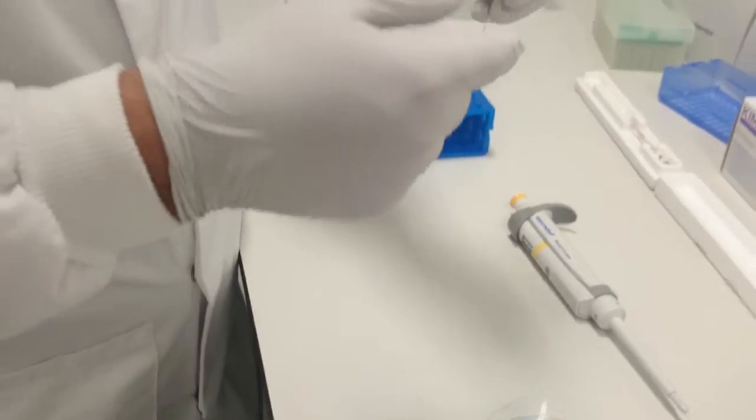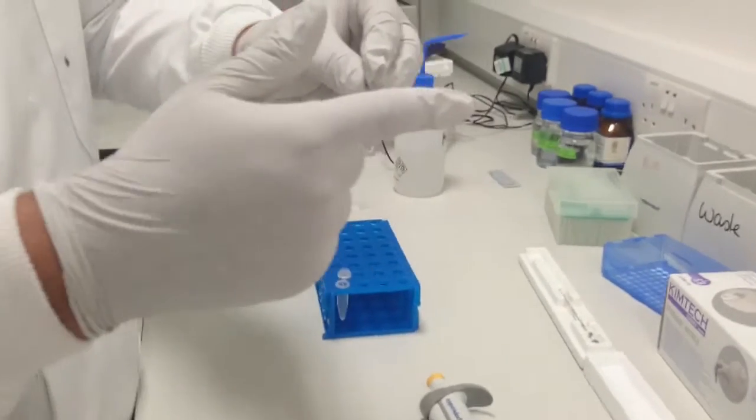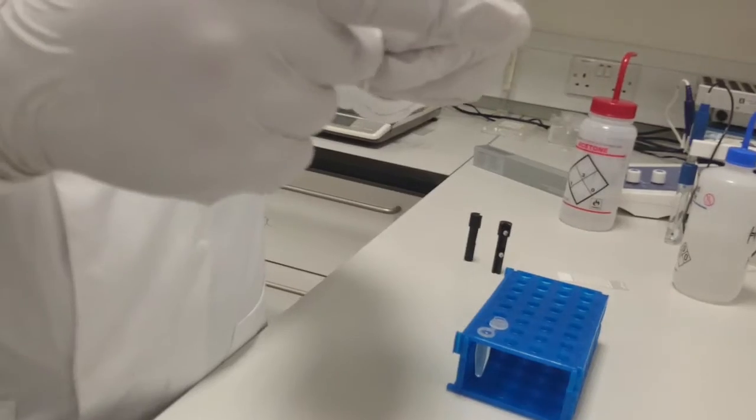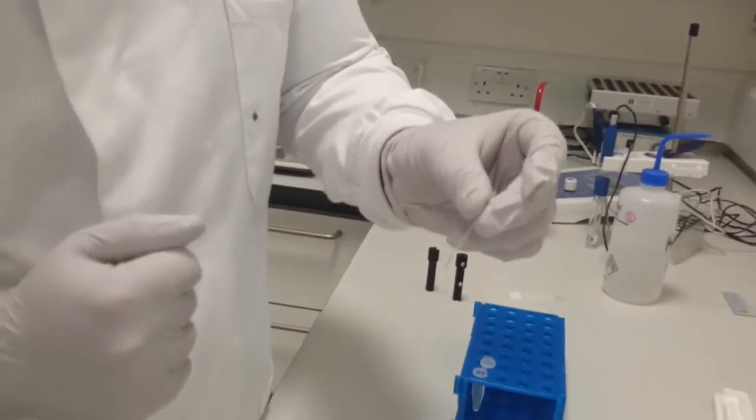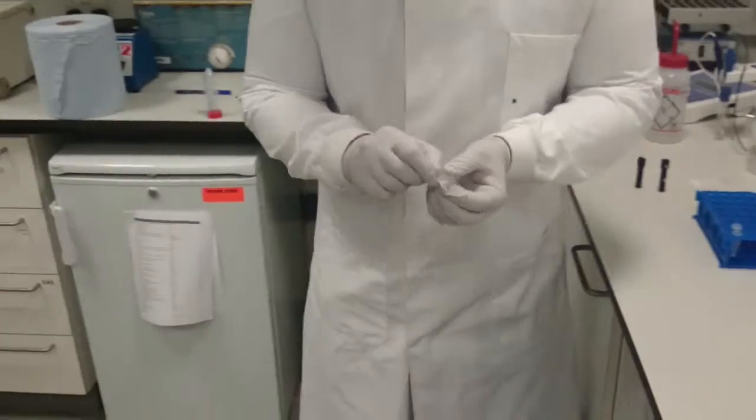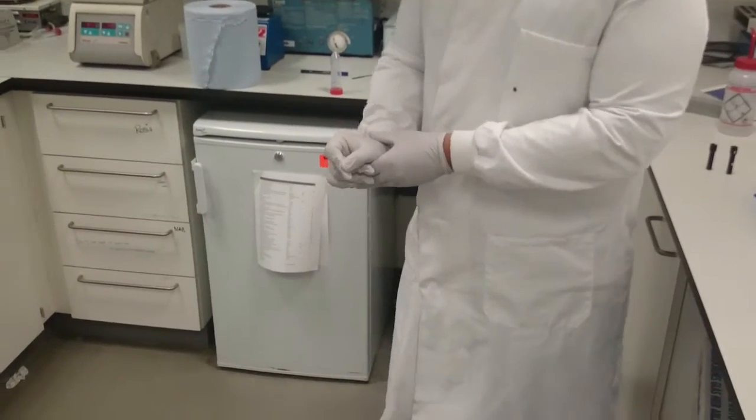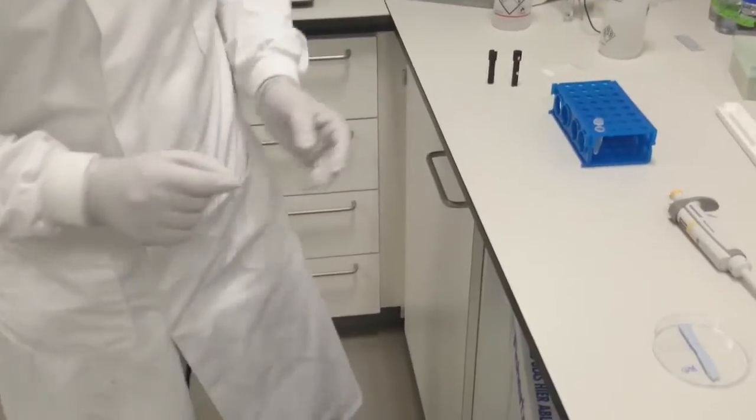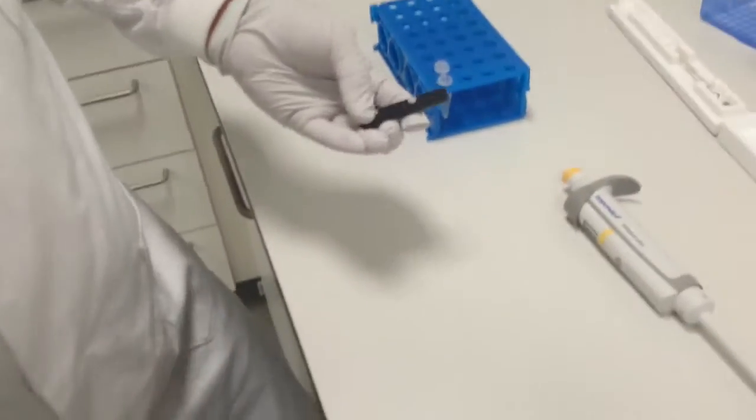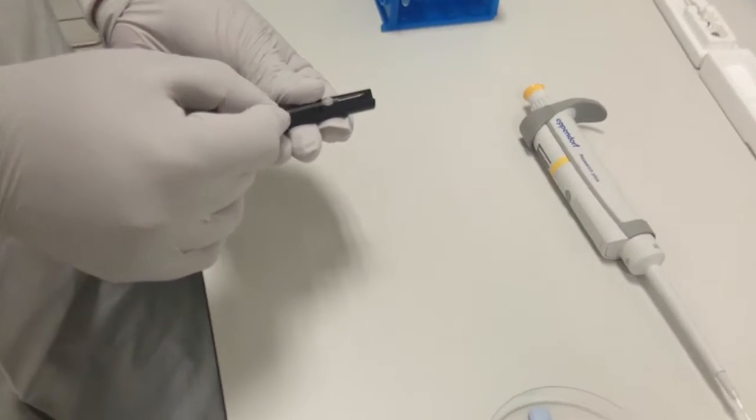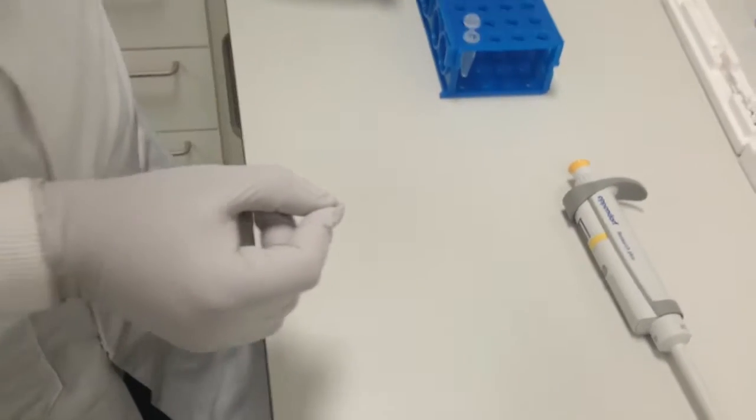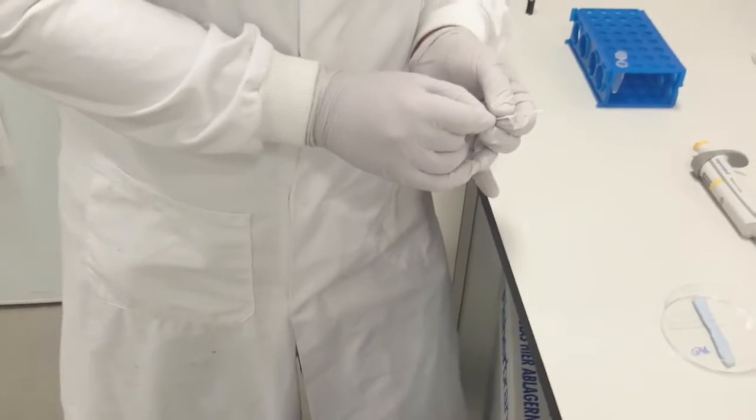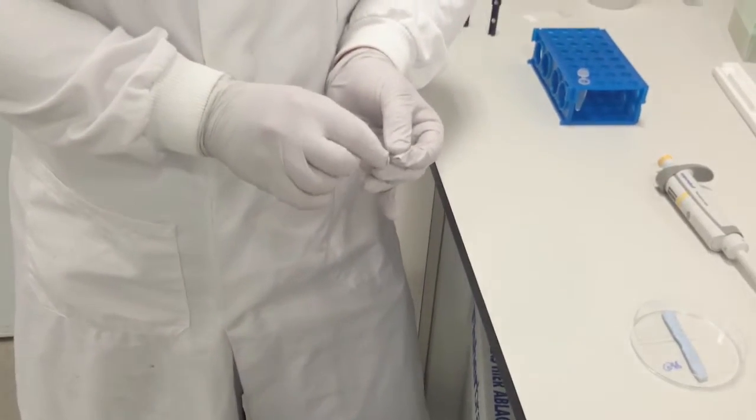The first is the tap. Hold your capillary and tap it gently with your finger. This releases air bubbles from the sides and they come to the surface. This will handle most air bubbles. The second method is the sharp downward flick. Be careful with the lab bench and those around you that it can be dangerous, but flick it sharply downwards. If these methods haven't removed your air bubbles, you can centrifuge your tips using a centrifuge lock like this, placing your tip along and clamping it. This method is very effective. However, occasionally you lose some sample. There's a requirement for very small sample volumes, although it will remove just about every air bubble.